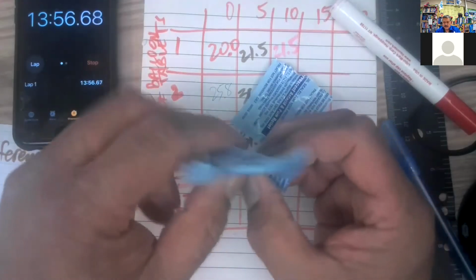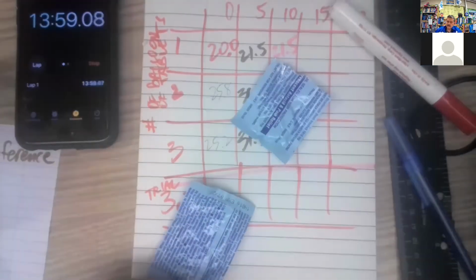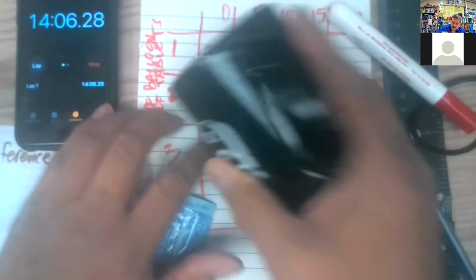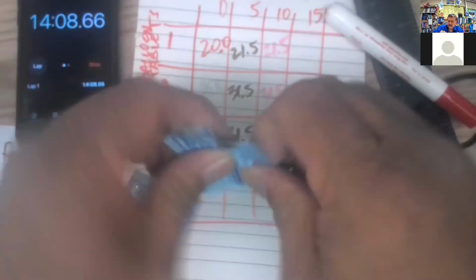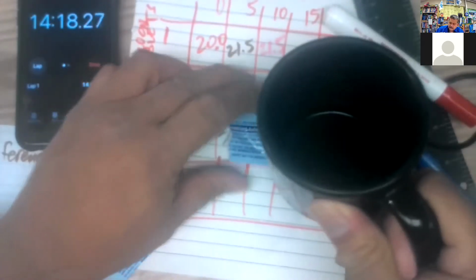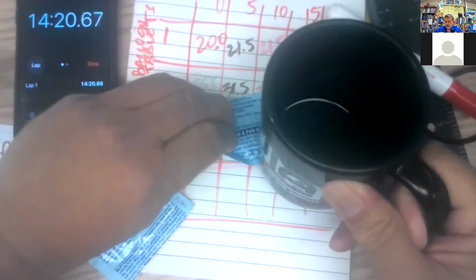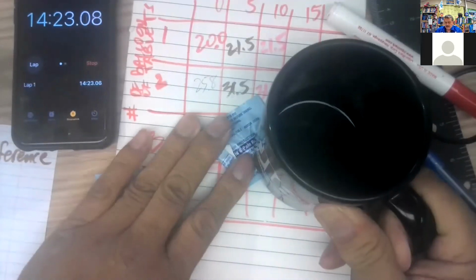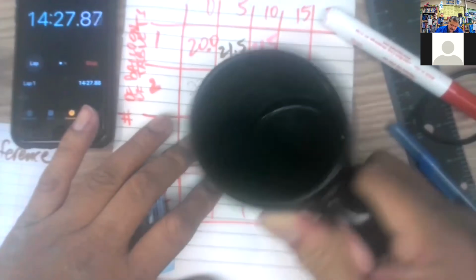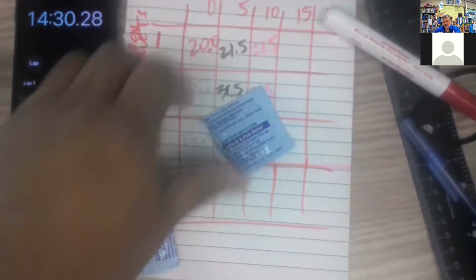Close to 14 minutes. And take the measurement and then run this other one. And then we can get the 20-minute measurements as well as the new measurement with the new 3 tablet. All right, so there's one.